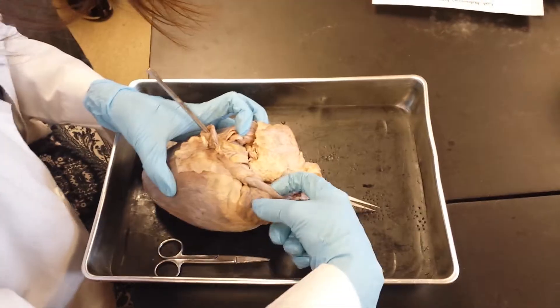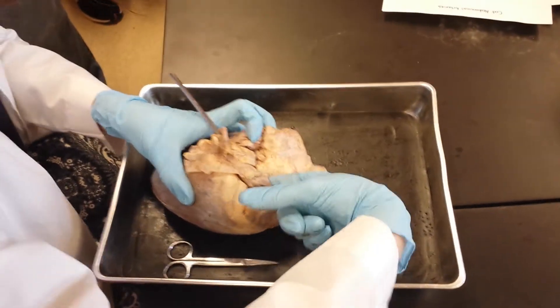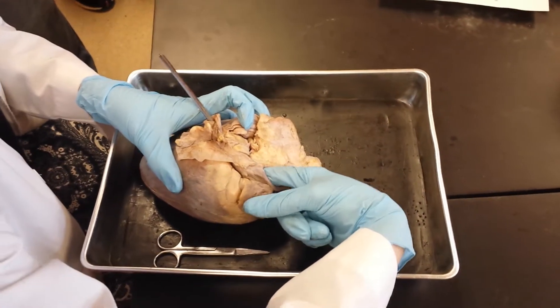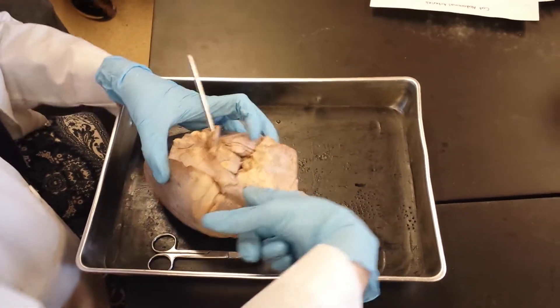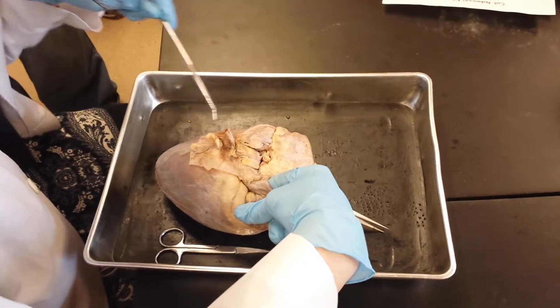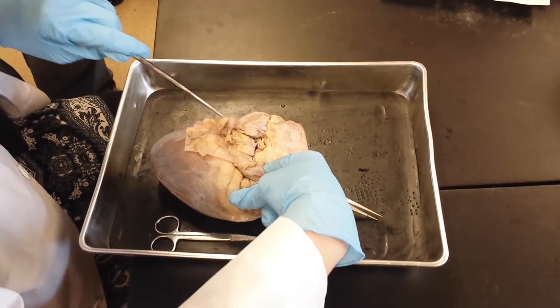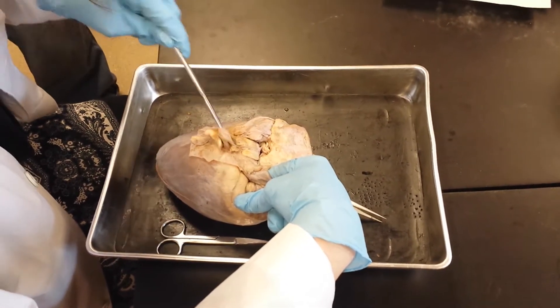This is my right atrium. In the cow, the superior vena cava comes in like this, and the inferior vena cava comes in like this.